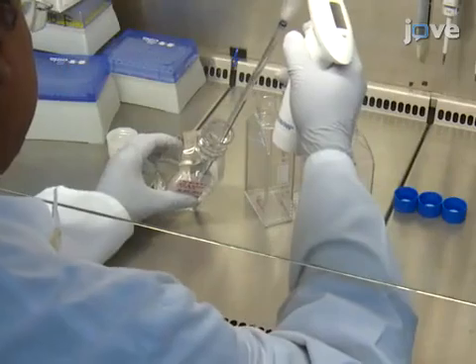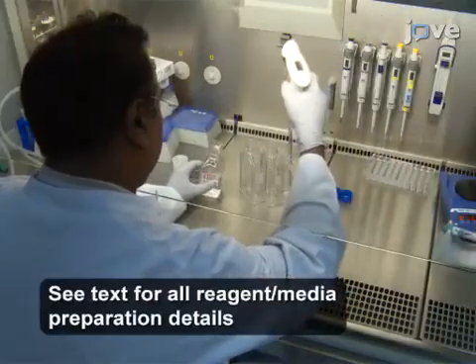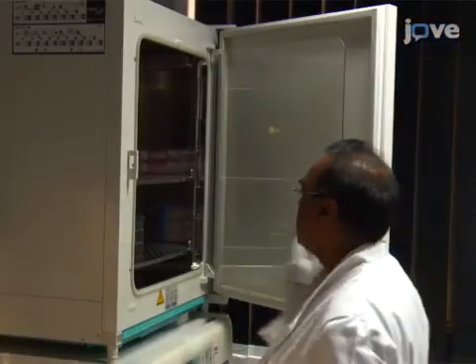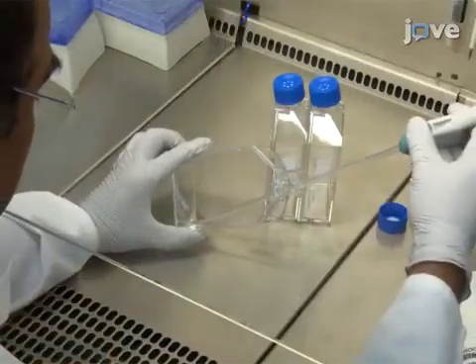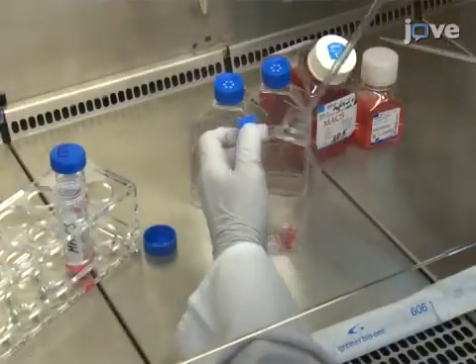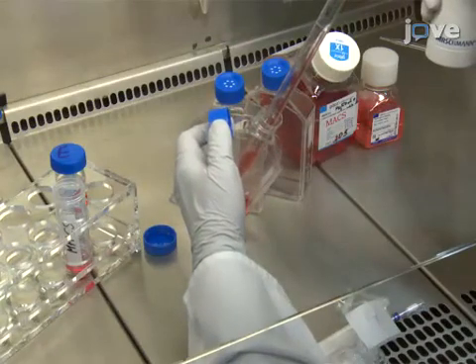To pre-coat the cell culture flasks, begin by adding a sufficient volume of freshly prepared gelatin to just cover the bottom of a sterile cell culture flask. Place the flask in a cell culture incubator for at least 30 minutes. Then remove the remaining gelatin solution and transfer the embryonic stem cell-derived early endothelial cells, or EEC, in enough media to culture the cells to 80% confluency.